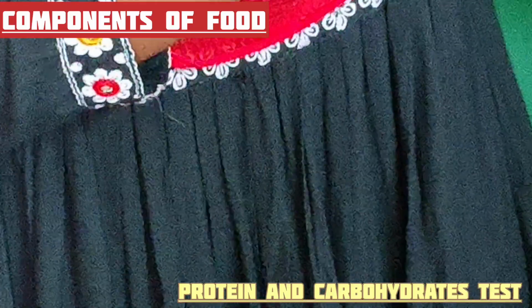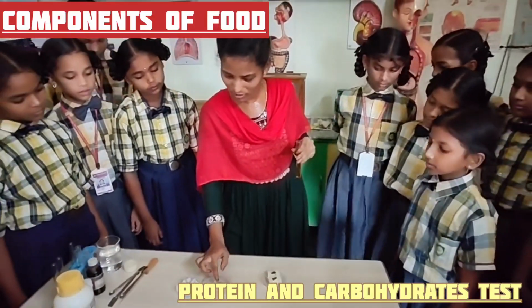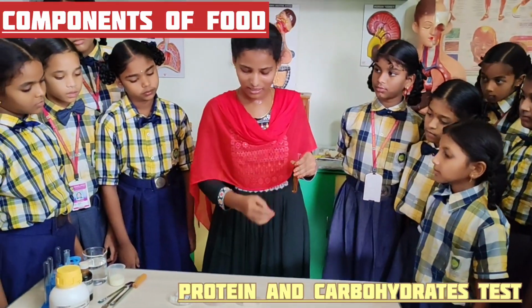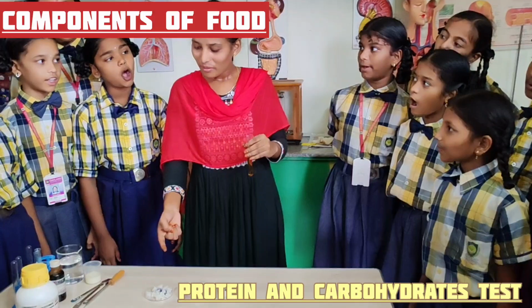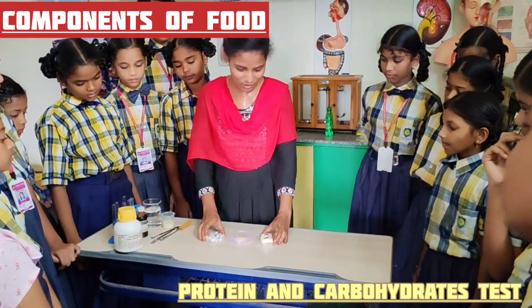Iodine solution is orange or brown in color, but when we add that iodine solution to these food materials, potato, peas, cooked rice and bread, it is converted into blue black color. That means these foods are rich in carbohydrates. Yes. So remember this one. These foods are rich in carbohydrate.